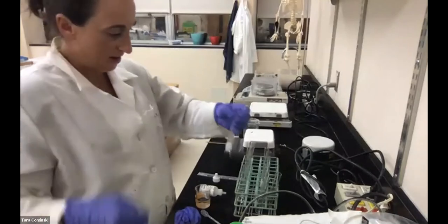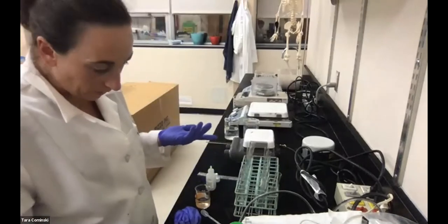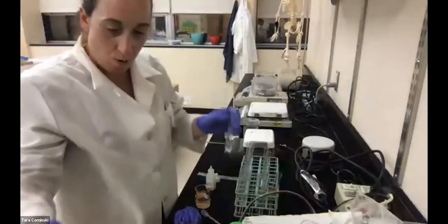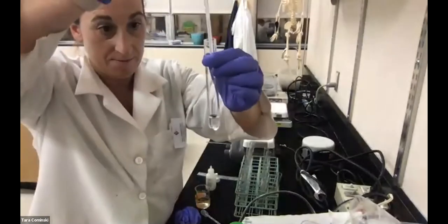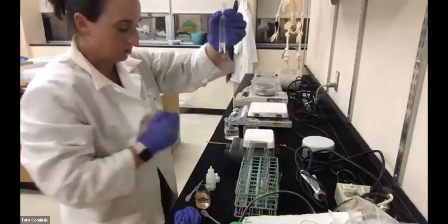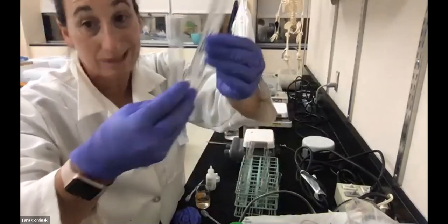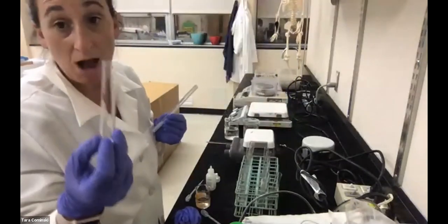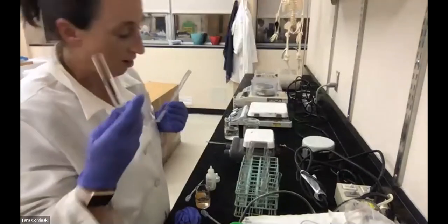All right, now to tube 1, I am just going to add water. So to tube 1, I'm gonna add 1 milliliter of water, and then we're gonna check to see what that bubble height is. Not really any bubbles, right? So we can just call that 0 millimeters. Tube 1 was hydrogen peroxide in 1 milliliter of water, 0 millimeters in terms of the bubble column height.